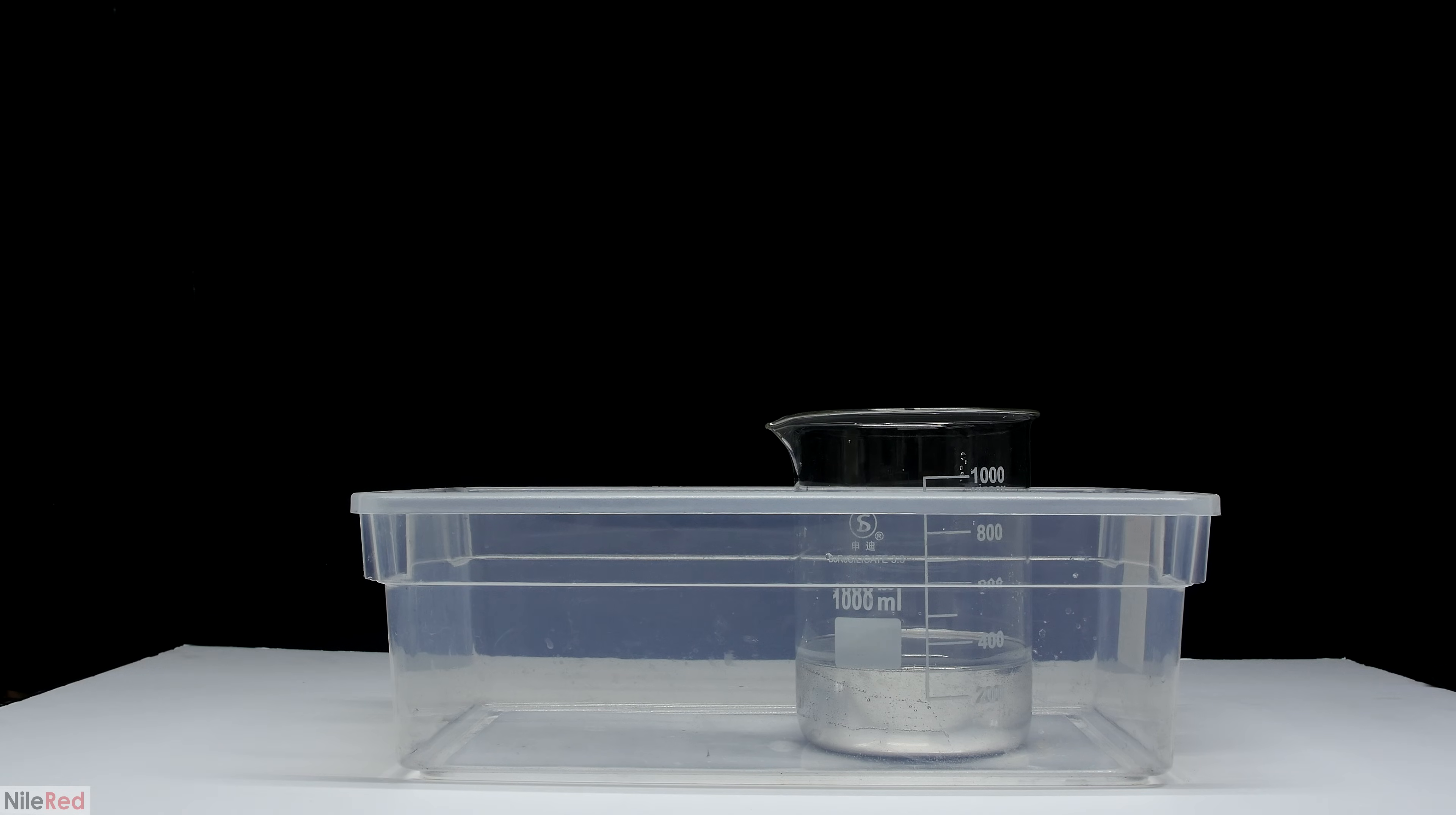It seems that keeping water over mercury is more useful if you're working with an open container. For long-term storage, it seems like the vapors build up anyway and all you really need is a nice tightly capped bottle.